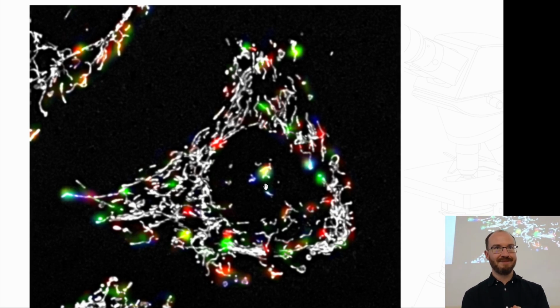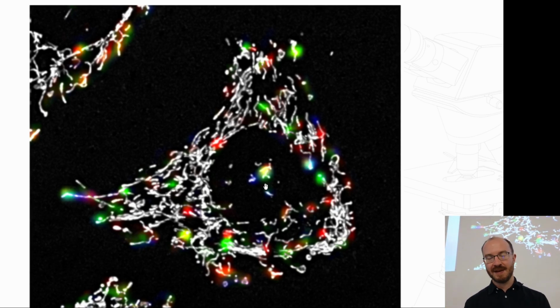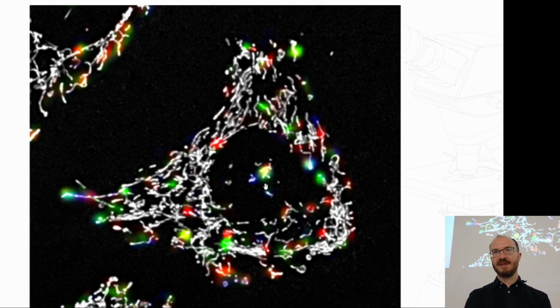It only saw 1 frame. So it accurately predicted 50% of the locations purely based on the morphology of how the sample looked at the moment. And also, an event that might have been incorrect was only incorrect necessarily for the next 10 seconds, for the next frame.